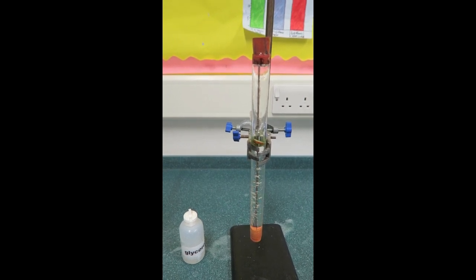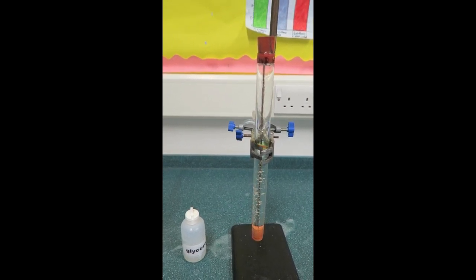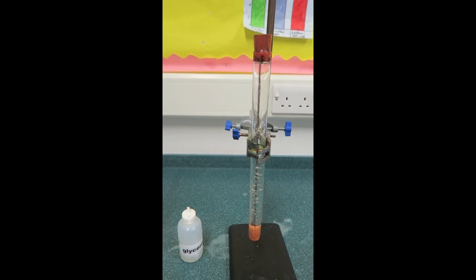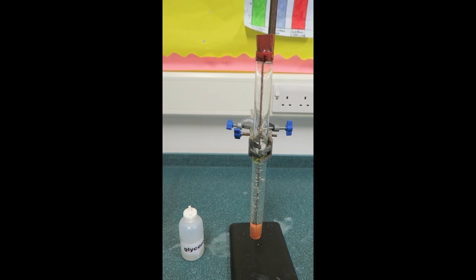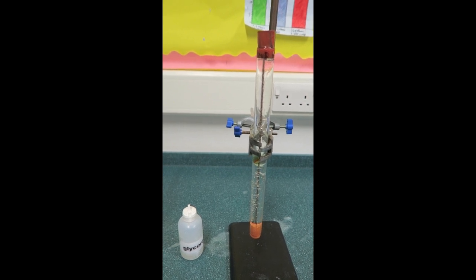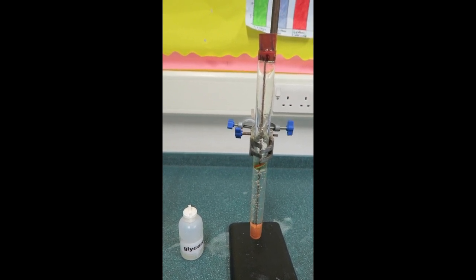It took 2 seconds for the marble to fall through the tube for water even though it has hydrogen bonding between its molecules because it is significantly less viscous than glycerol. For glycerol it took 1 minute and 10 seconds for the marble to fall through the tube.